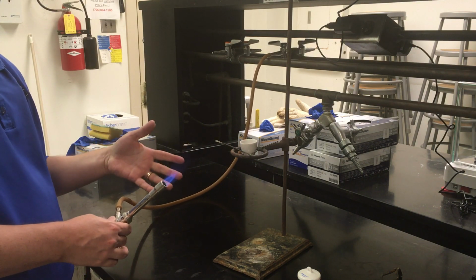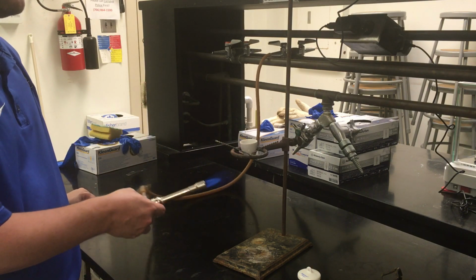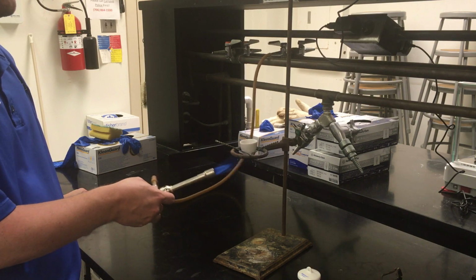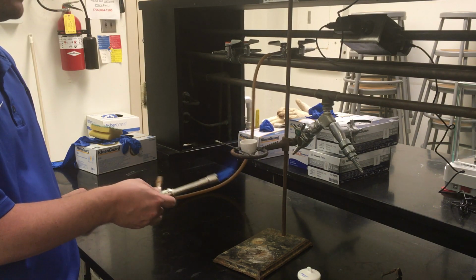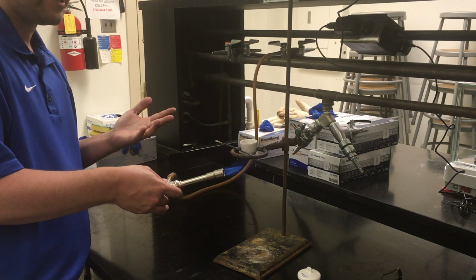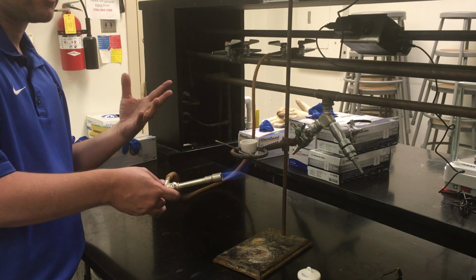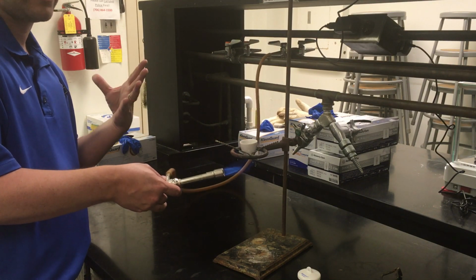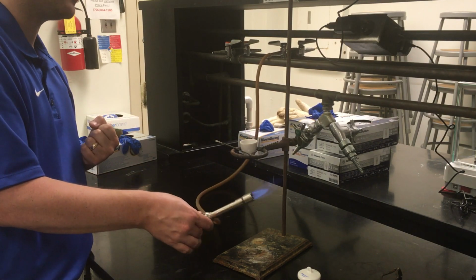Now, when you go to put the Bunsen burner under it, don't just jam it under it and blast it full bore with heat. Gently waft the flame under it for a little bit first, so you can slowly let that ceramic crucible warm up. Since it is ceramic, it's like glass, it will expand as it warms up, and if it's a really big temperature change, it can shock the ceramic into cracking because it's trying to change its size and expand too fast. So just be gentle with it.